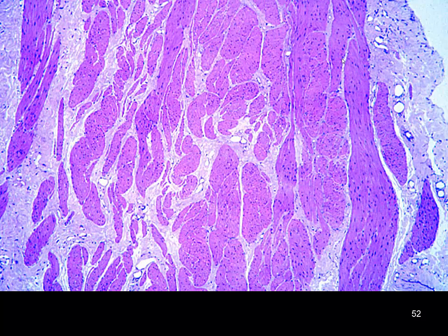Again, different view of the same thing, bundles and bundles and bundles of smooth muscle. We can sort of see some transverse sections of our smooth muscle in this location, and then we've got more of a longitudinal section through here. You can almost see that flowing or streaming view, and then different twisted up views here. It's difficult to pick those out. Here's some more longitudinal sections of smooth muscle right there.